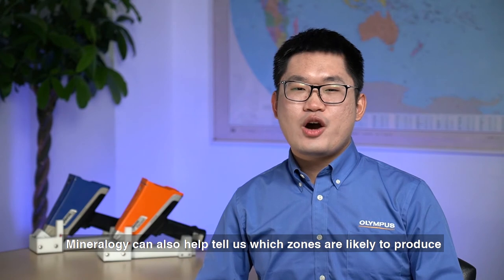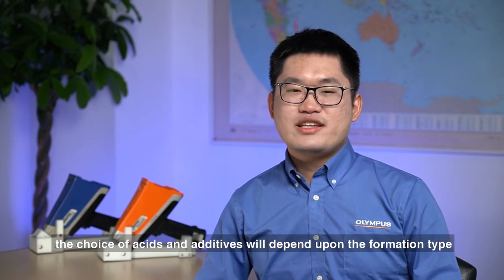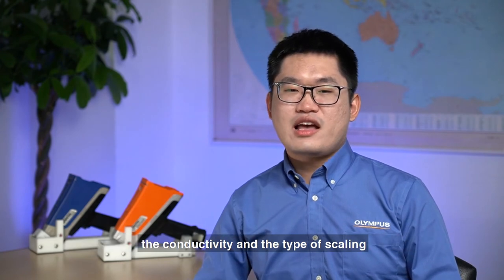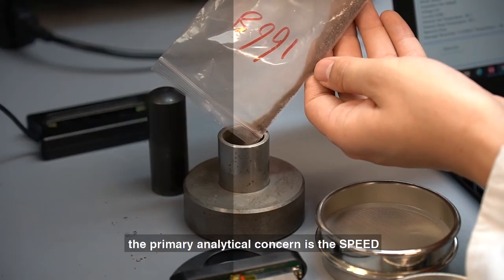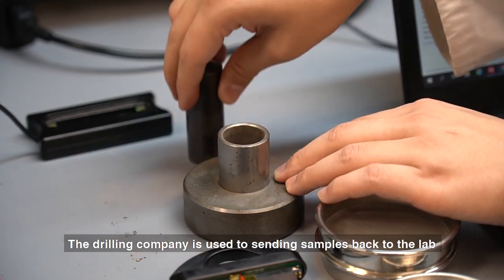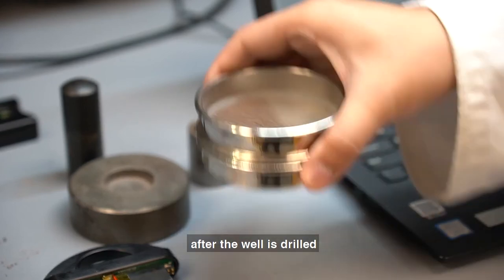Mineralogy can also help tell which zones are likely to produce and how much pressure to use when fracturing the well. The choice of acids and additives will depend upon the formation type, conductivity, and the type of scaling building up on the inside of pipes. During mud logging on-site, the primary analytical concern is speed and business value. The drilling company is used to sending samples back to the lab for XRF and XRD analysis after the well is drilled.